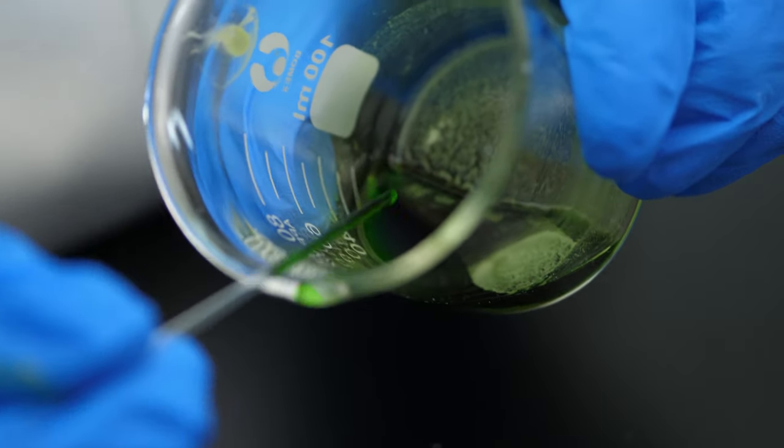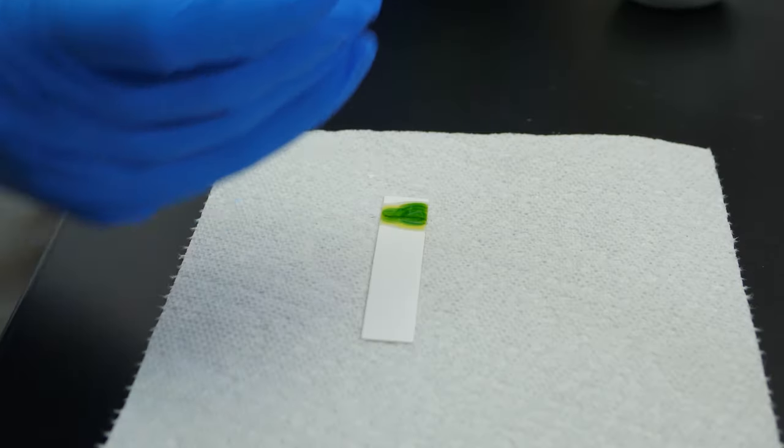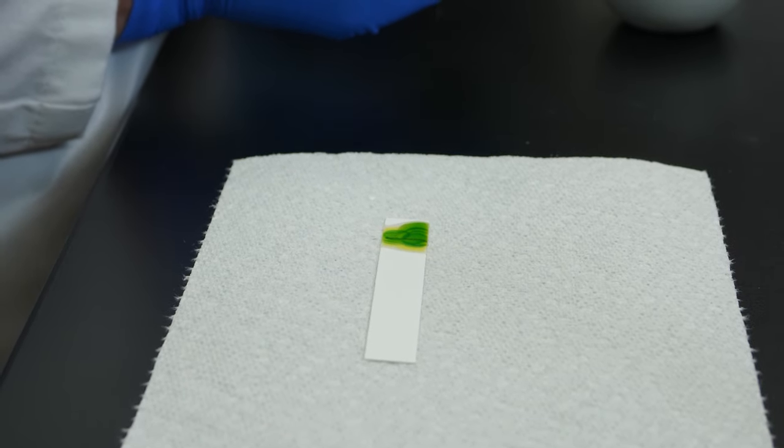Then, we place several drops of the mixture on the origin line. We let the plate dry for four minutes.